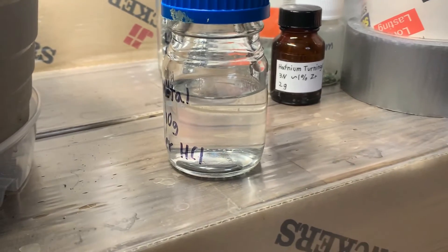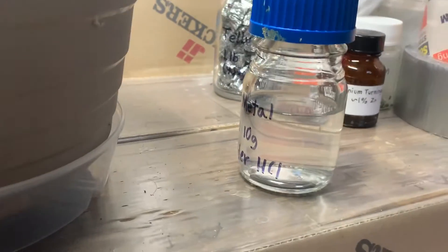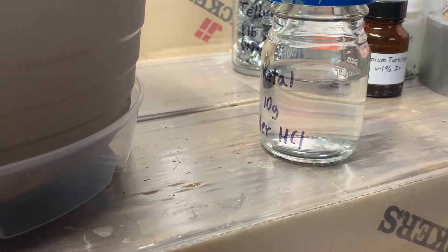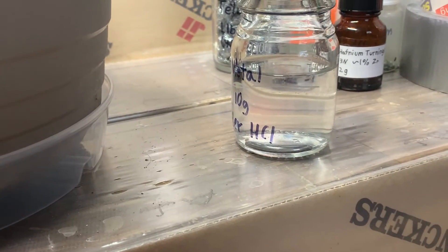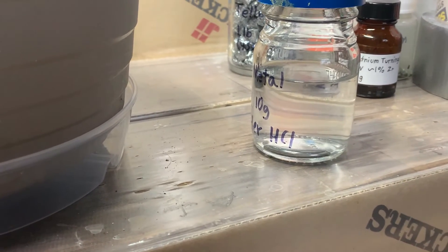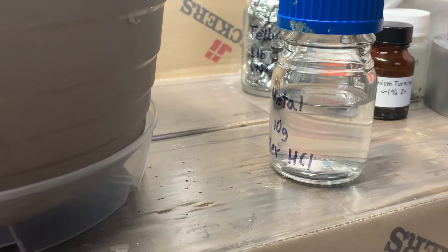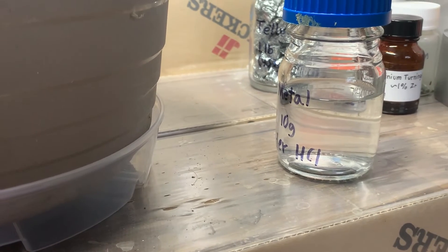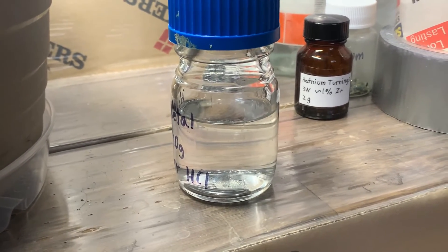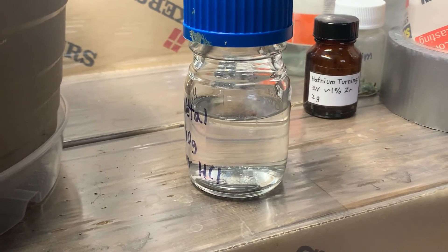I've been messing with this a little more, and that's given me enough information to make me relatively sure I know what the impurity was. Previously I listed three possibilities — aluminum, zinc, and magnesium — based on the fact that they dissolved in the acid and didn't give the solution any color. However, there are actually three problems with this list. First, aluminum oxide doesn't dissolve easily in hydrochloric acid at room temperature — I'm not sure it would have dissolved as quickly as we saw. Second, zinc oxide, magnesium oxide, and aluminum oxide are all white, but the buildup on the original mercury was black.